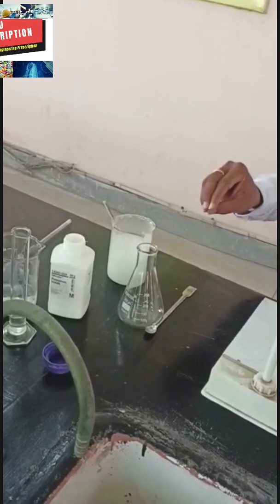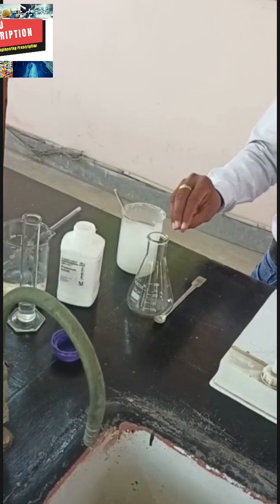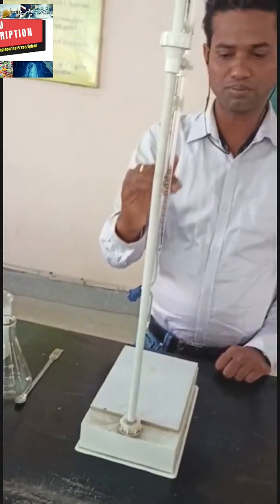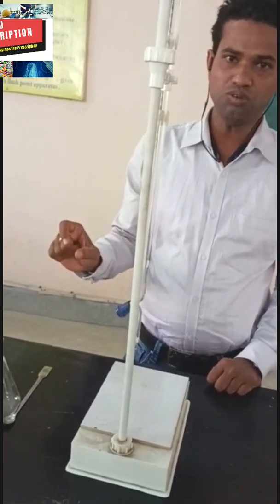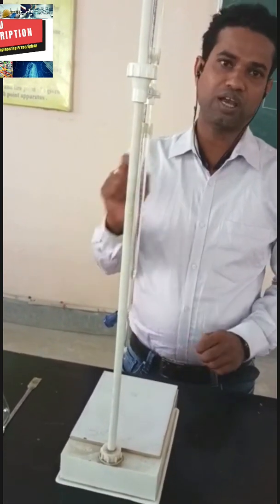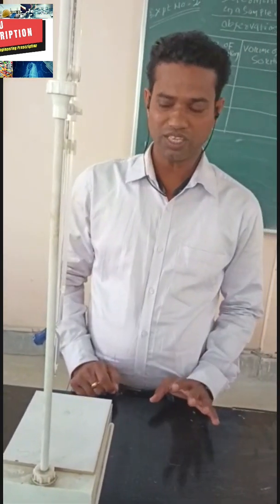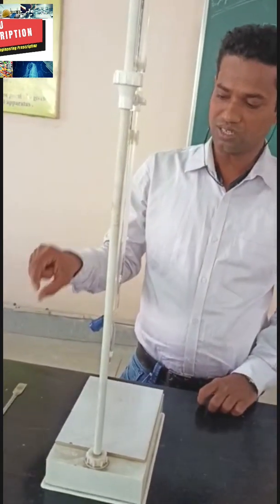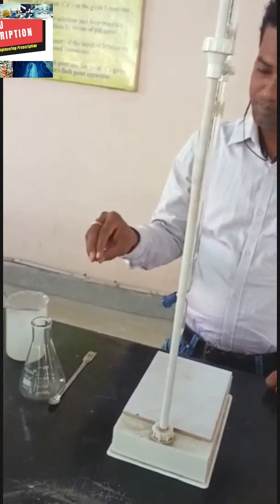When iodine is liberated, it gives the characteristic color of iodine — that is brown color. When the brown color appears, you start addition of hypo solution from the burette until that color changes to pale yellow. When pale yellow color appears, we add the indicator starch solution. After addition of starch solution, blue color appears.